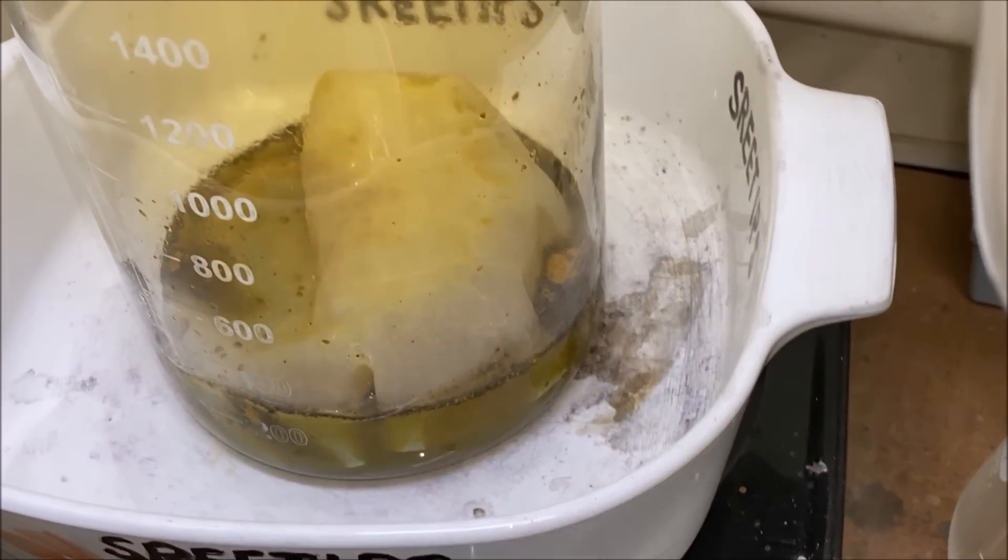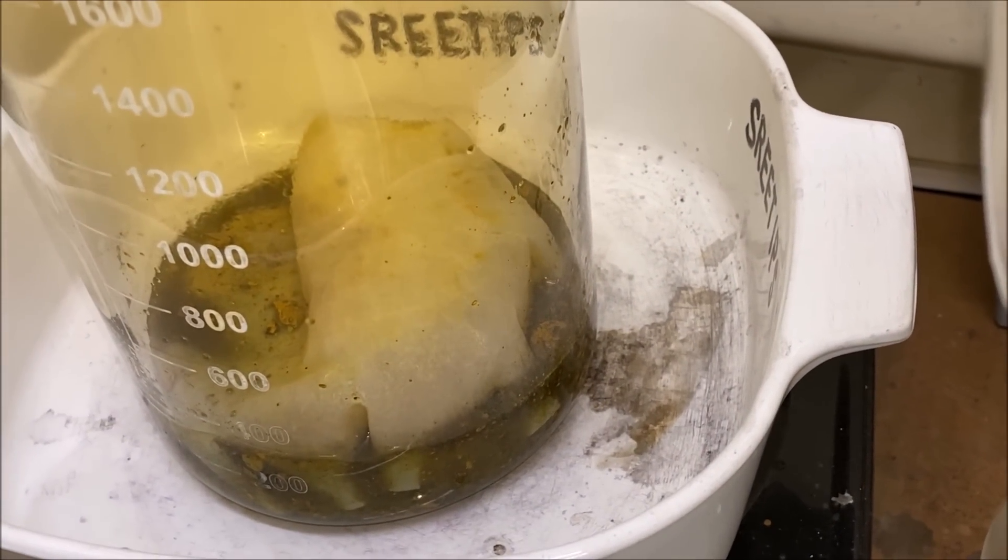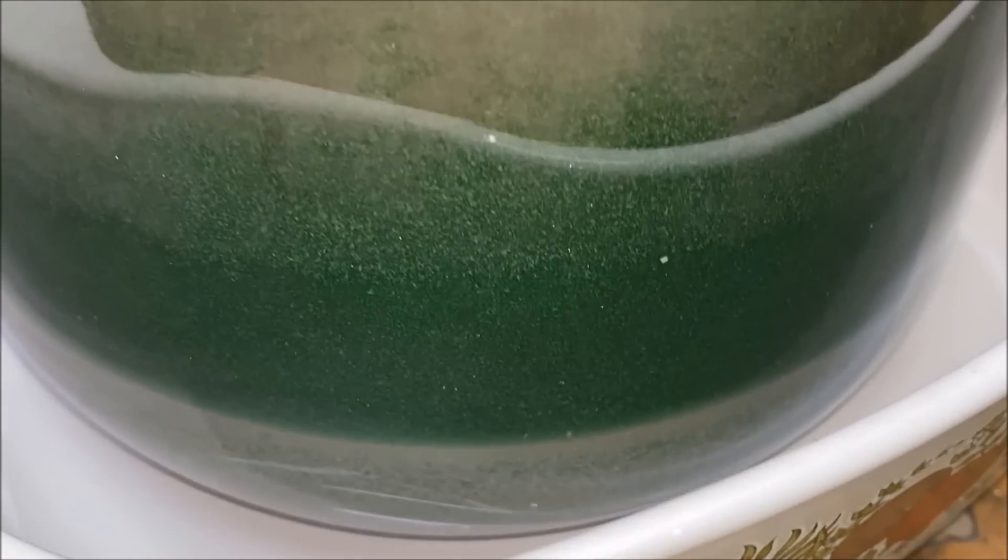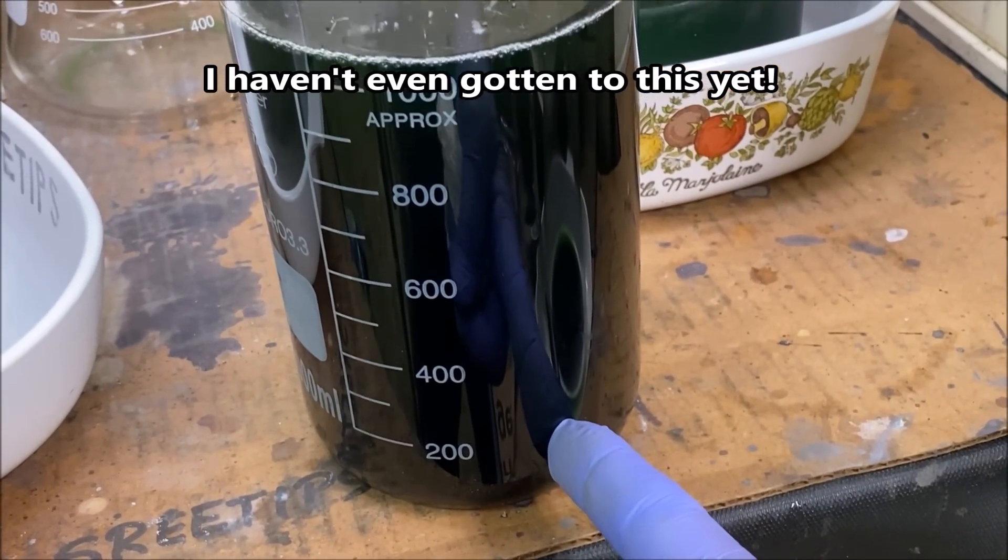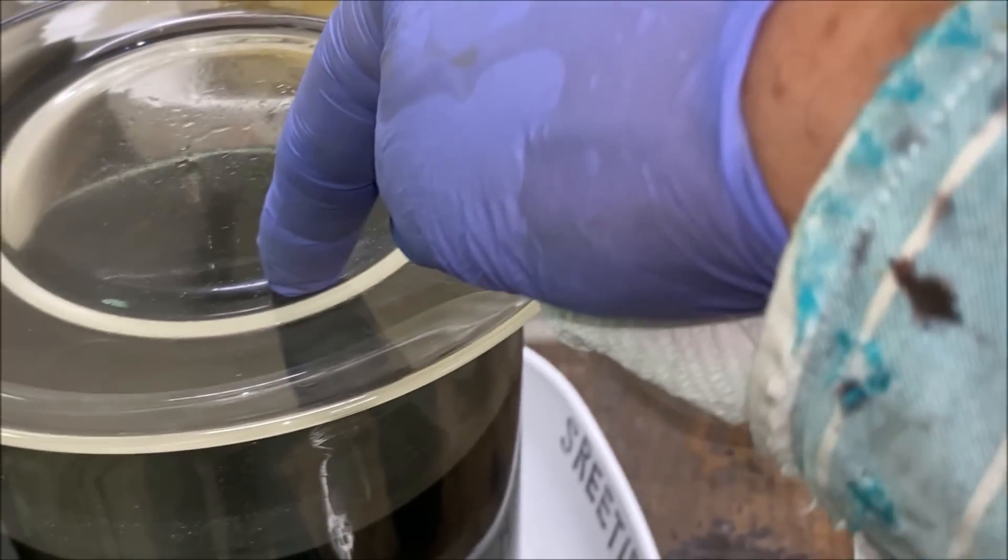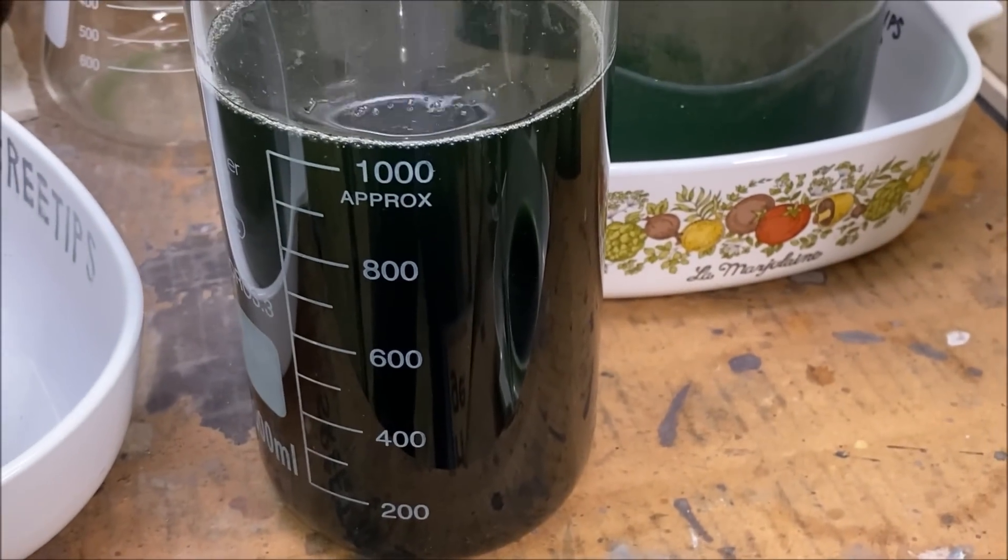Here's the dmg precipitate in here with the metallic silver. I've got it in some nitric acid to try to pull the silver out and leave the dmg palladium precipitate intact. I've got one jar of silver cementing out here, I've got another jar cementing out here, and then of course I've got my main solution here. This is going to have our solids in it, our main prize, gold and platinum group metals. We just pulled a little bit of palladium out of these two solutions, but the main prize should be down here in the bottom.